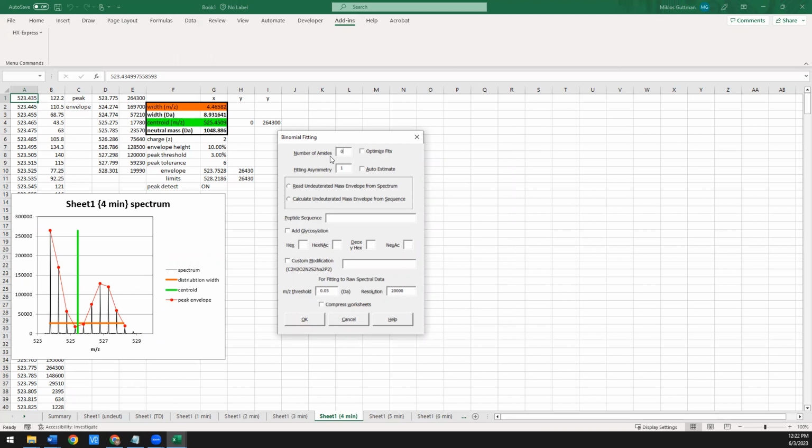It wants to know the number of amides. If you have 0 in there, it'll automatically guess from the sequence of the peptide. If you say optimize fits, it'll actually vary the number of amides to get you the best fit. And I highly recommend everyone start using that. You don't have to, but it tends to give you better results. The fitting asymmetry we're not going to use today. If you want to read about that, it's in the HXExpress version 2 paper.